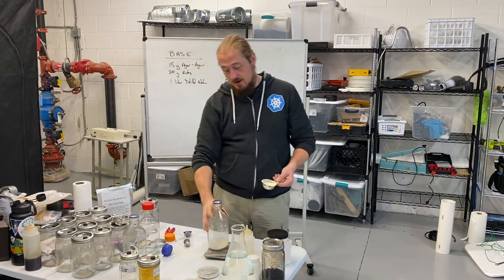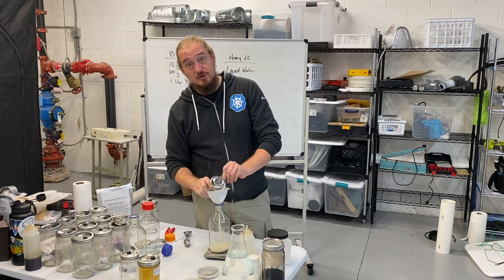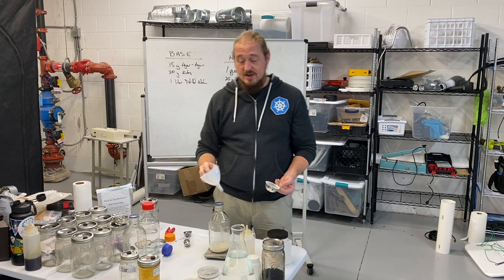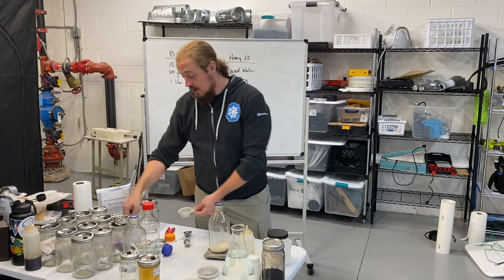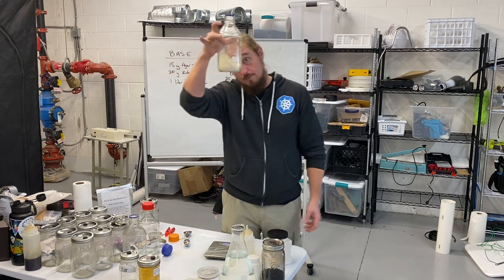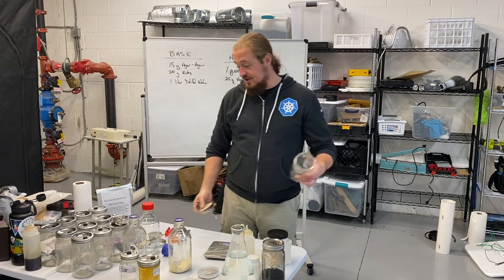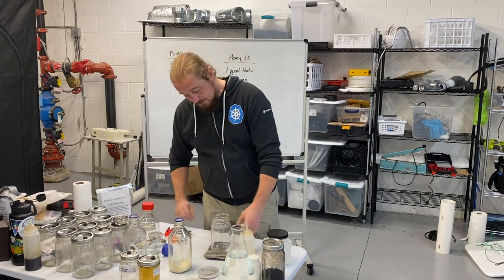Bottle: 15 grams agar agar. Use a dry funnel — this stuff is so sticky that the second it hits moisture it will turn into a hot mess and a disaster. For this LC, I'm actually just going to do a sorghum.